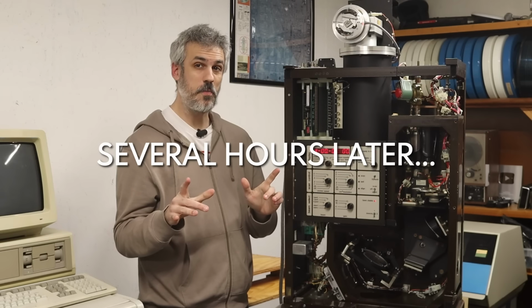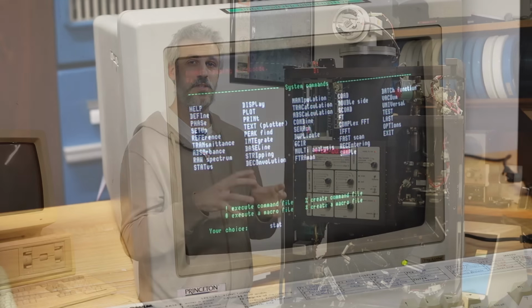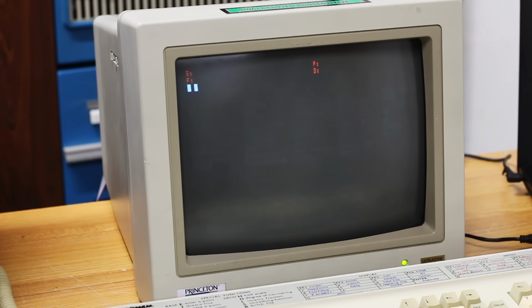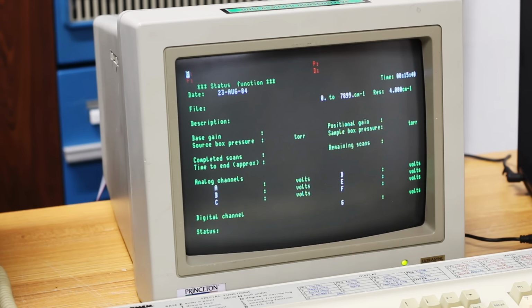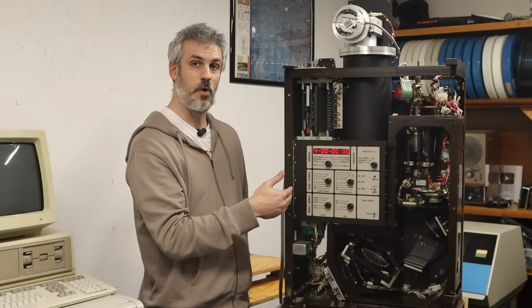All right, I had a little call with Mike and we did some experimenting. The PDP-11 software is kind of obtuse and nobody's used it for like 20 years, so it's taking a little bit of learning. But it seems that we have decent communication between the PDP-1173 and the high performance vector processor. However, we don't have any communication between the high performance vector processor and the Bomem here.